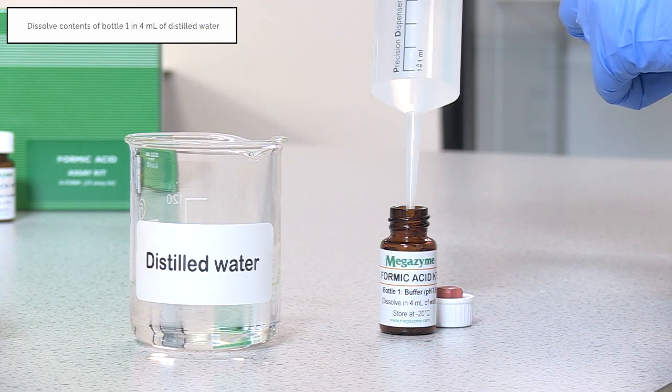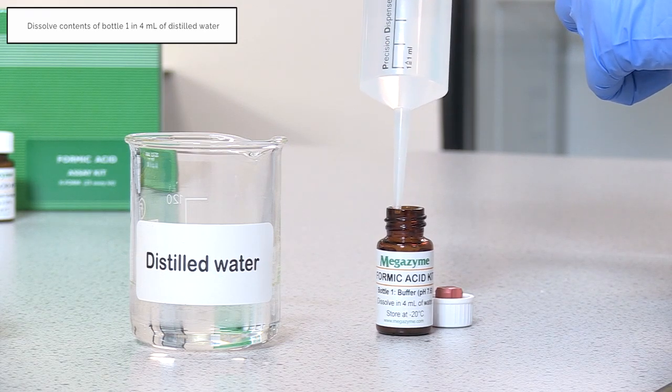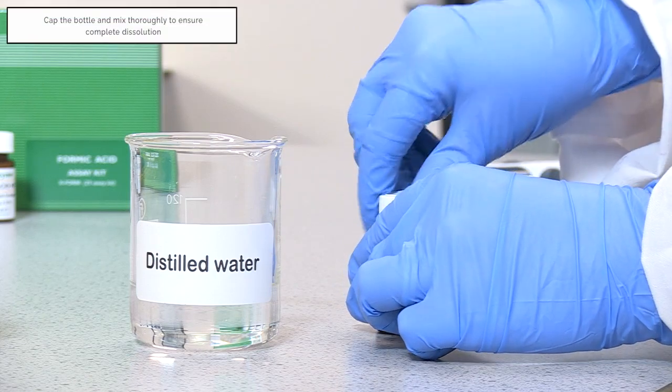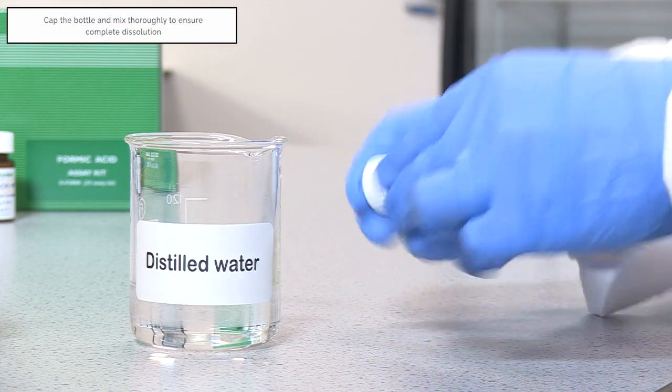The contents of bottle 1 are dissolved in 4 ml of distilled water. The bottle is capped and the contents are mixed thoroughly to ensure complete dissolution.